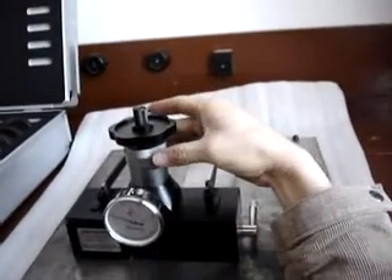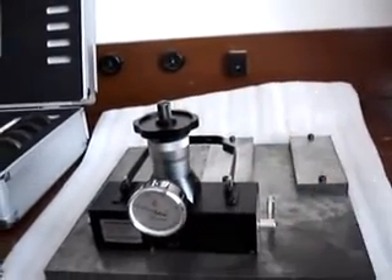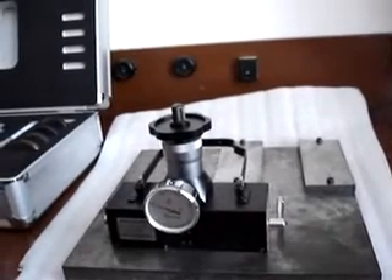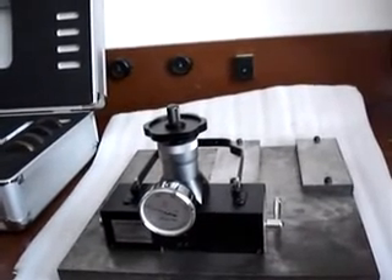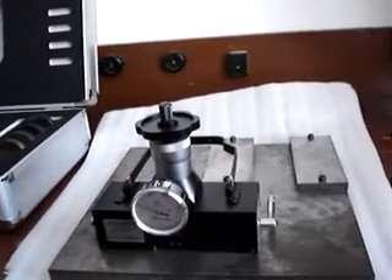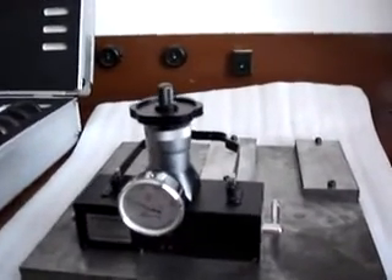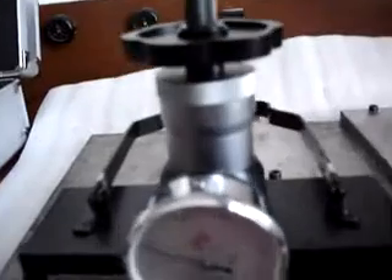And then, adjust the barrel dial. Rotate the dynamic barrel dial anti-clockwise to bring the full scale marks exactly aligned with the scale marks of the static barrel dial.